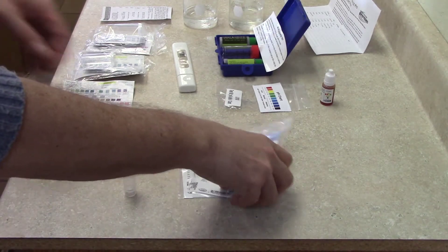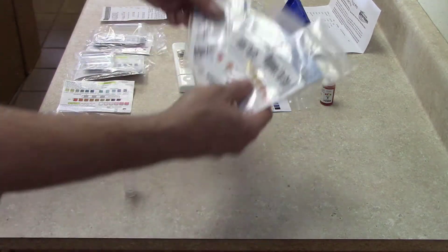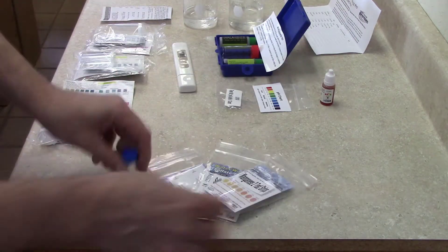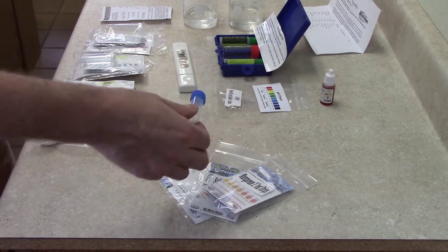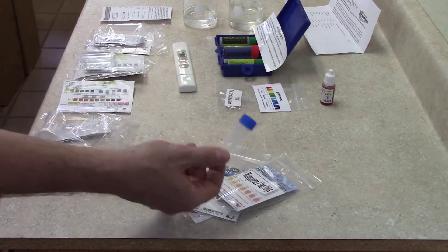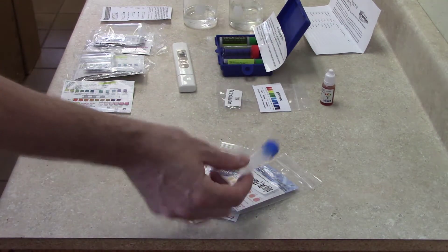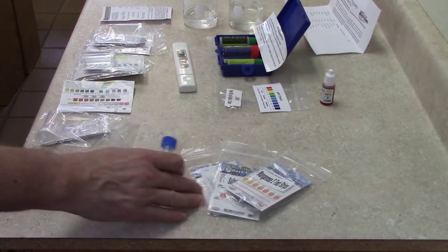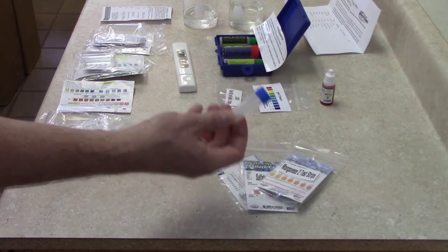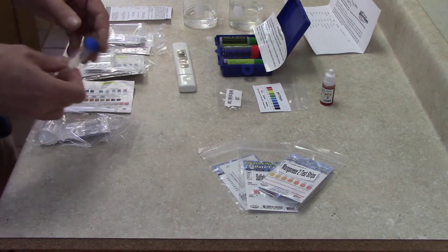Manganese, sulfate, and hydrogen sulfide test strips. You get one vial and you're going to use that vial, rinse it out, and then use the same vial for the next test. So you get one vial for all three of those tests. That's the idea there.